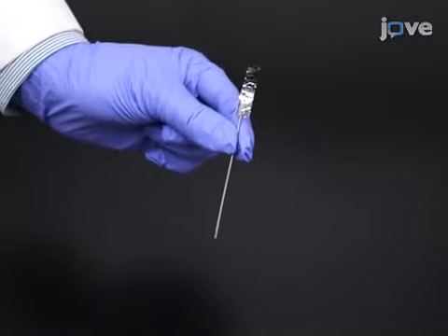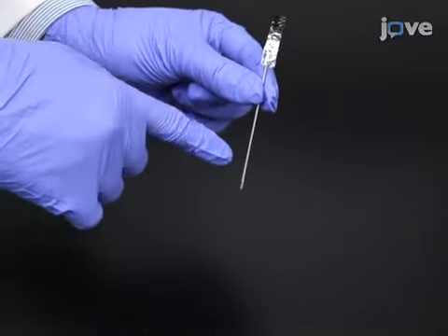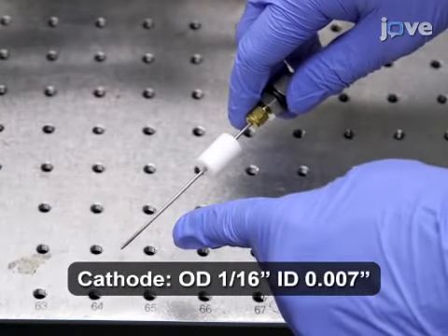Use an anode made of a piece of platinum foil attached to a stainless steel rod, and a cathode made of a sharpened stainless steel capillary.